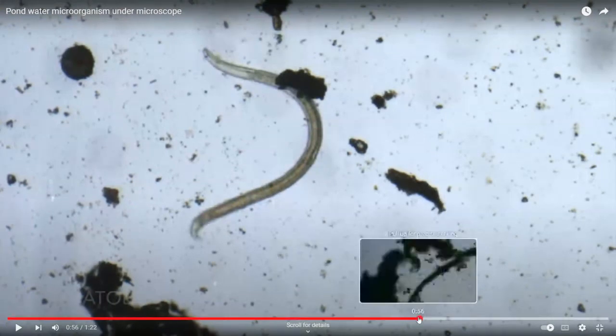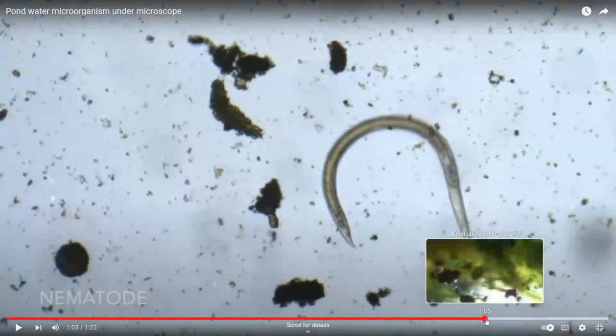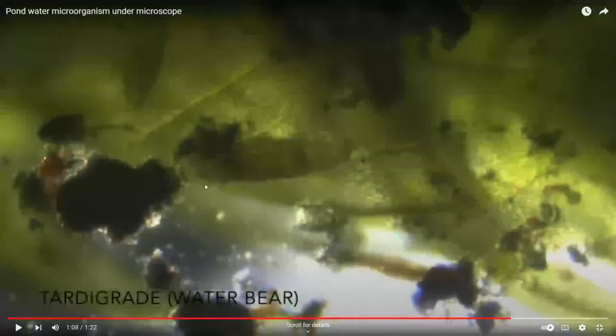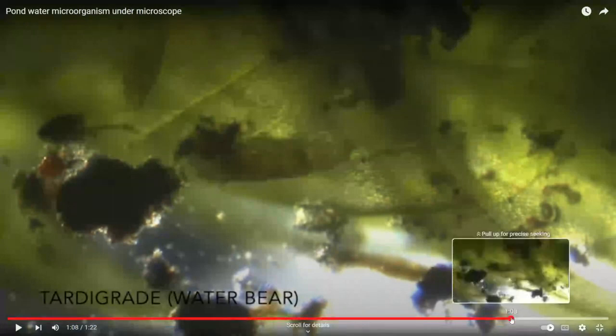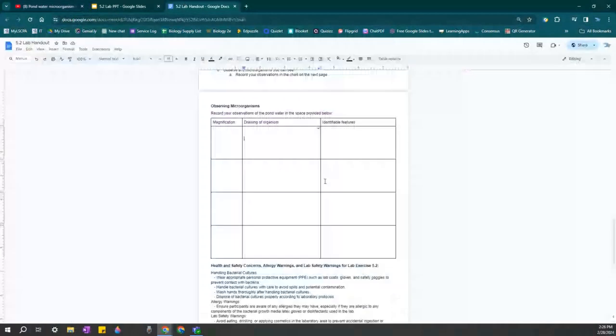So what you can do is zoom through one of these videos, pause maybe. This is actually a really helpful video because it has labeled the nematodes. It labels the water bear. This is a water bear here, or tardigrade. They're very interesting little creatures. Just pick one of them and draw a small sketch of it and any identifiable features that you see. And that will go in this box.